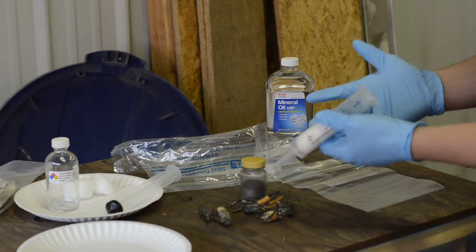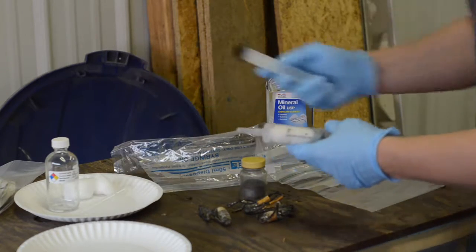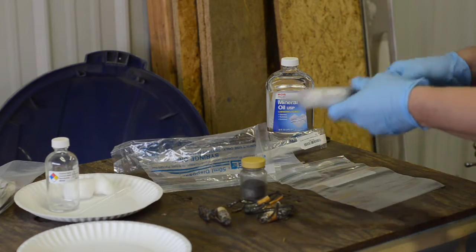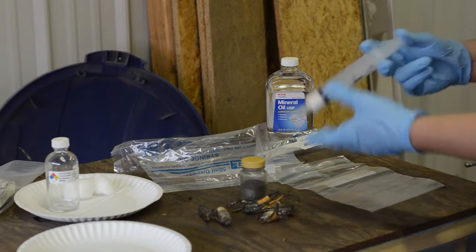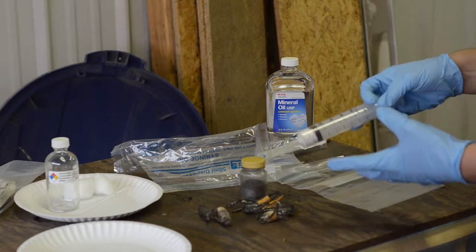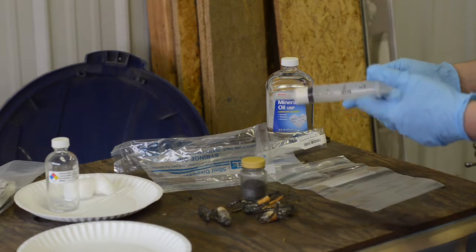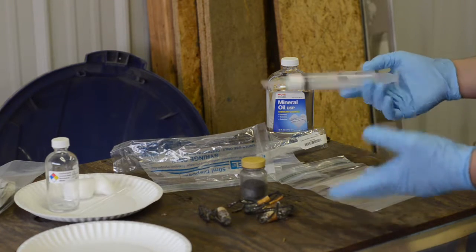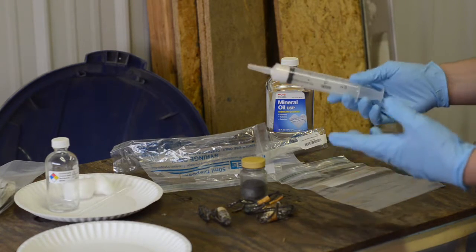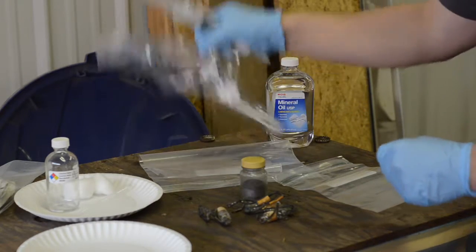This will be in the two mercury storage videos I found online. This was a pretty standard kind of technique. There's some more in-depth videos about how to distill the mercury and do other stuff like that, but I don't plan on using this in any chemical reactions anytime soon, so I'm just going to go with the mechanical filtering and call it a day. All right, so we've got our mechanical filter ready.